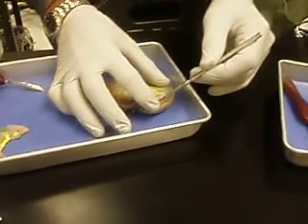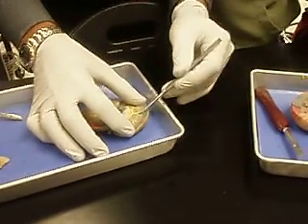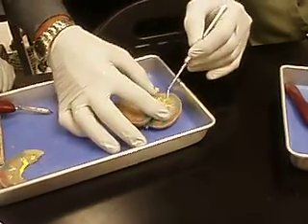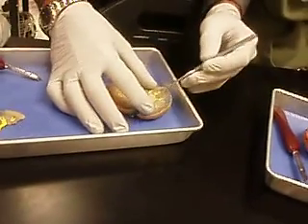And you can see they have a collecting duct ending all the way up here. That's what I hate about the sheep kidneys, because they've got them all the way up in here. There's a little tiny one here. Can't see a renal column in here very well. This looks like a renal column. Here's a piece of a renal column. So you don't have the beautiful straight lines that you see in a pyramid.